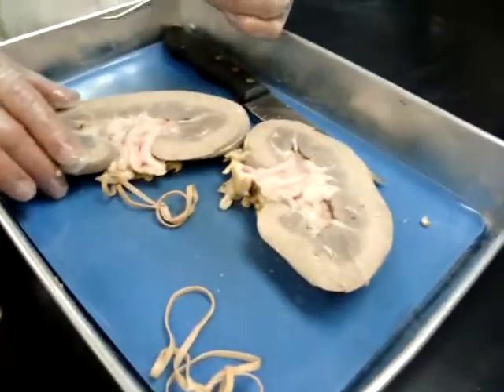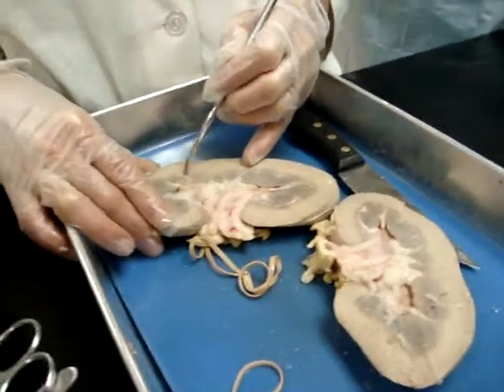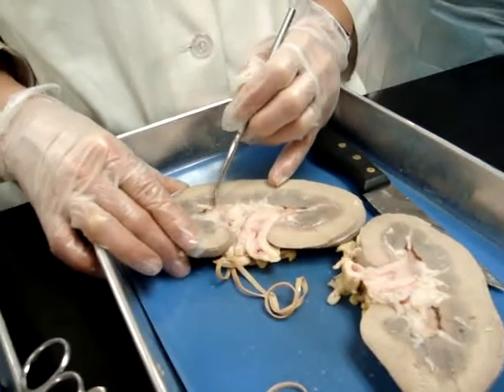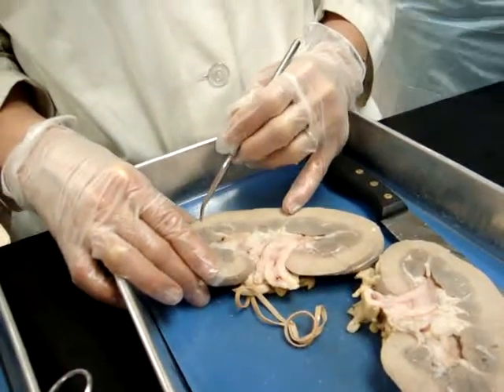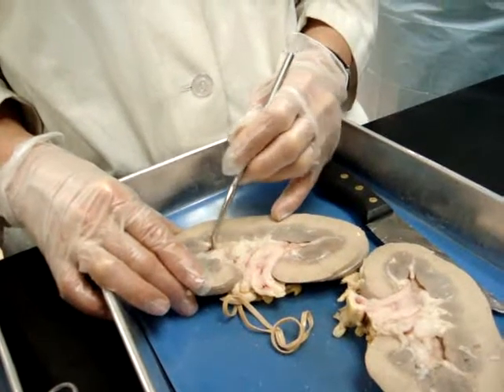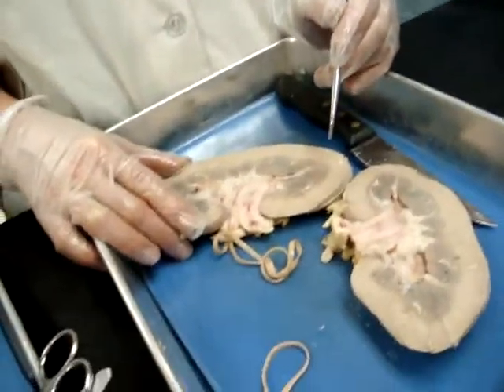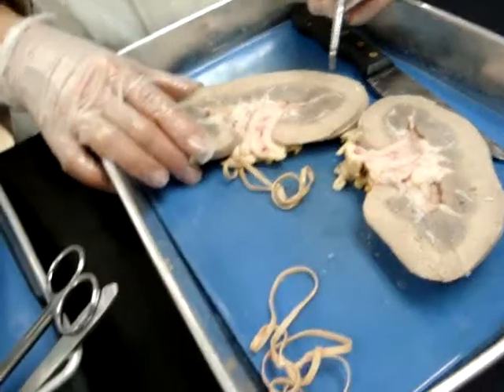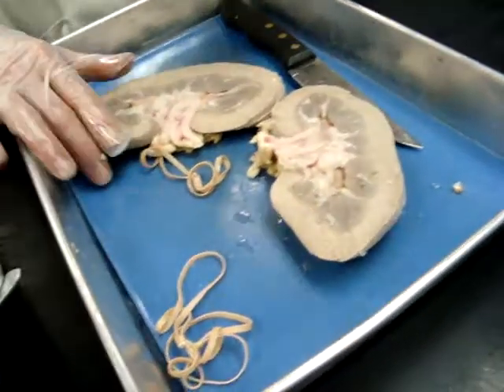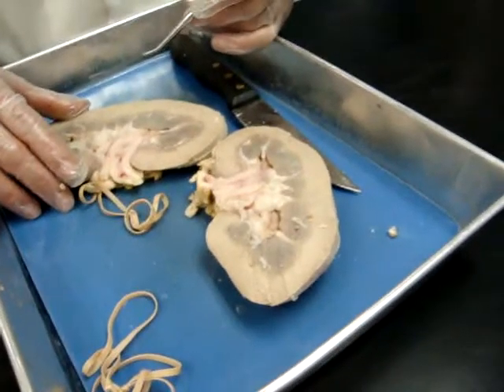Did you say the lobe was... The lobe is half column, half column, pyramid, and cortex above it. So it's like this segment — like that is a lobe. It's just a segment. In one of the diagrams, you'll see the lobe — I've segmented out a lobe.